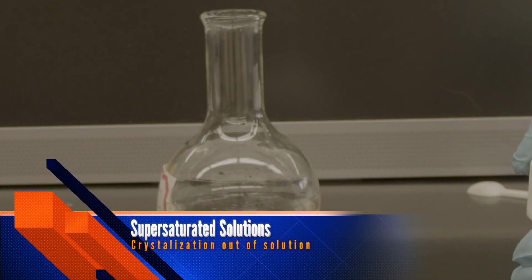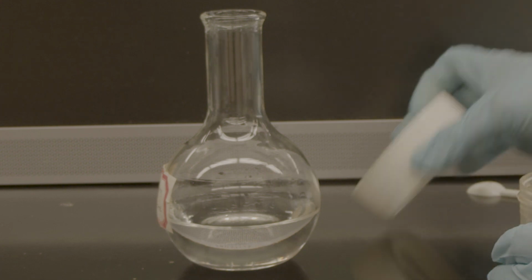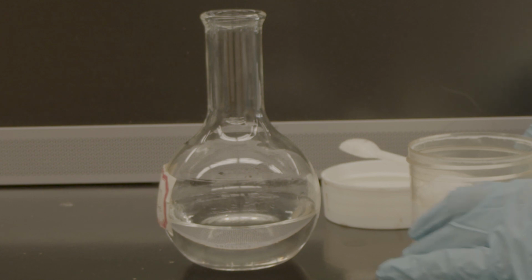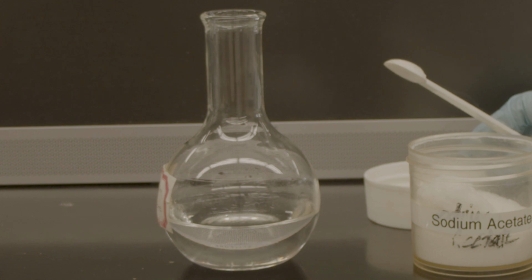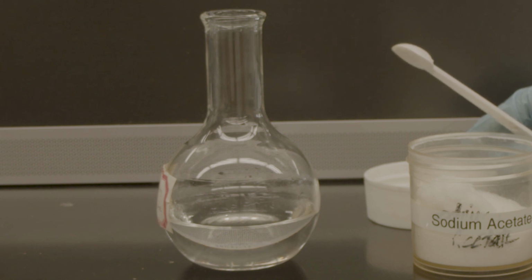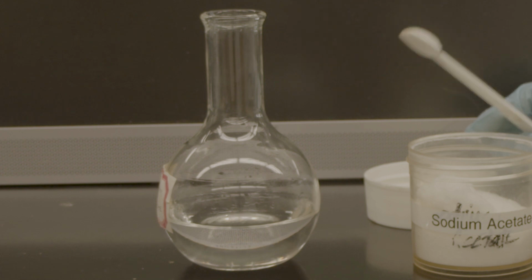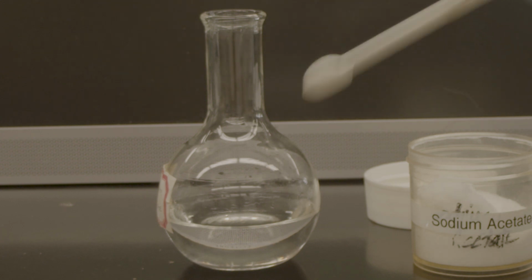This is group 5, preparation of saturated solution. We are going to use sodium acetate in water. So what is the definition of a saturated solution? A saturated solution may dissolve the maximum amount of the solute in the water at a certain temperature. After that point, it will not dissolve any more solute. That's the saturated solution definition.